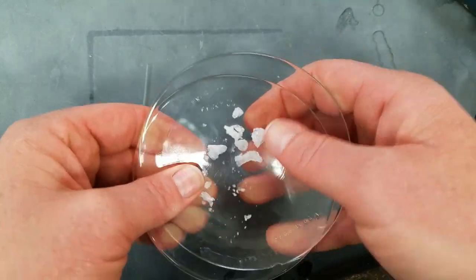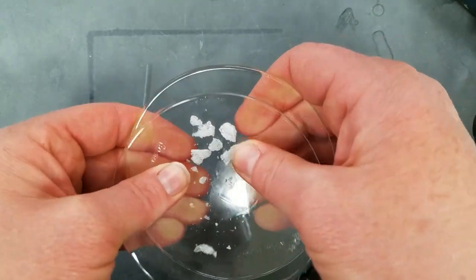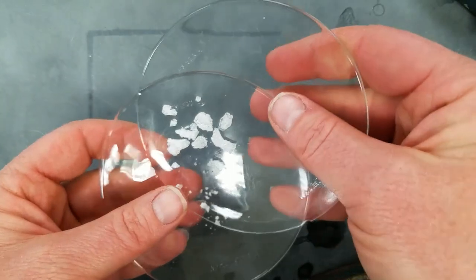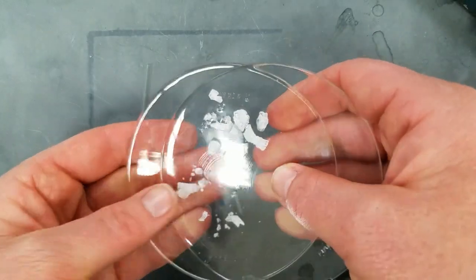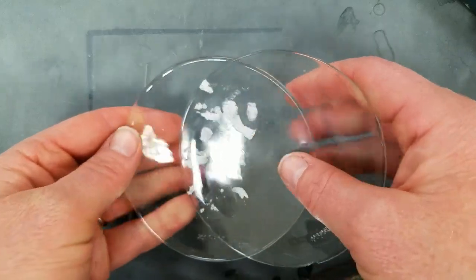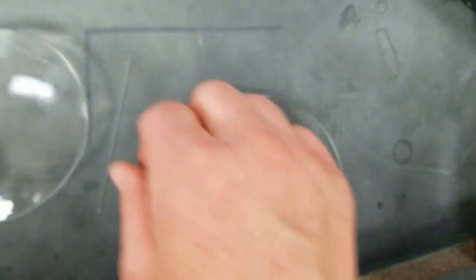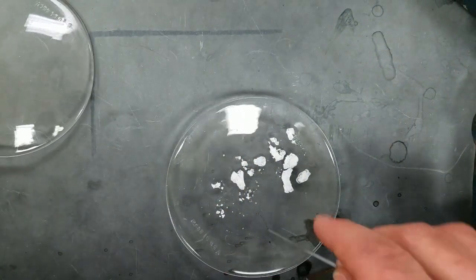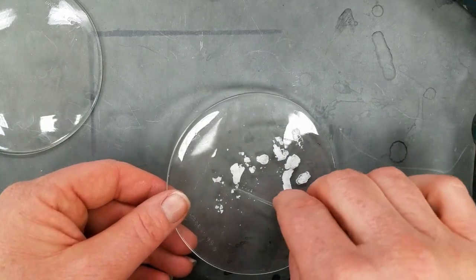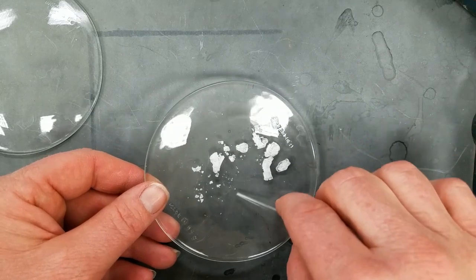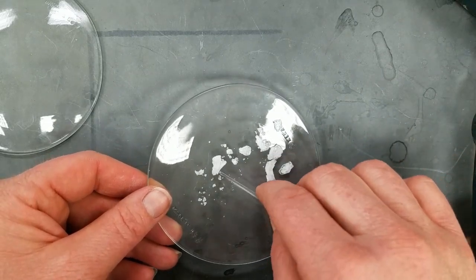Once we get it into smaller pieces, we can use our little capillary tube to run through those smaller pieces and tap them down into the capillary tube.